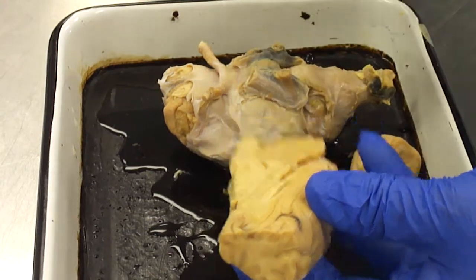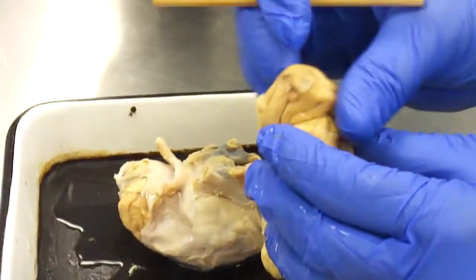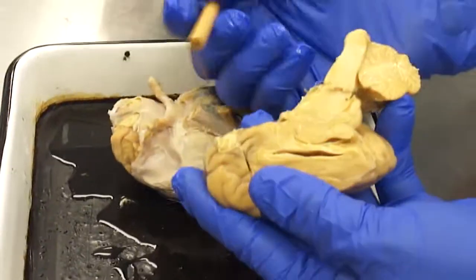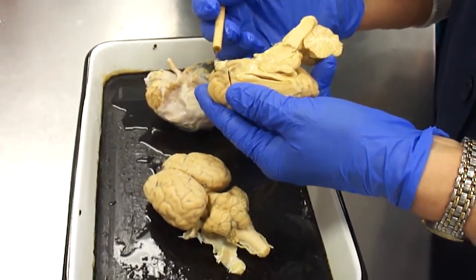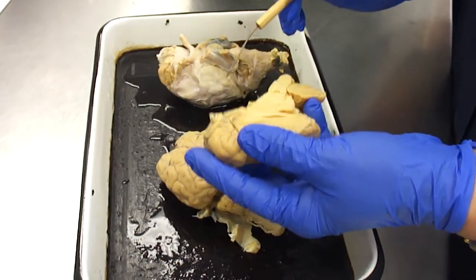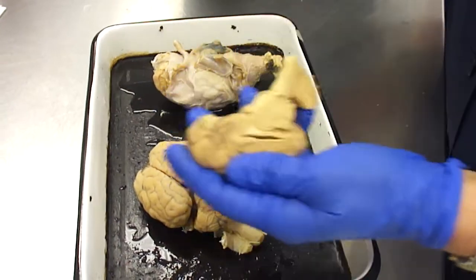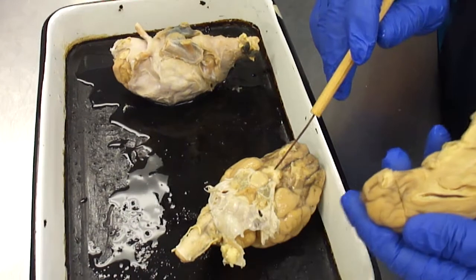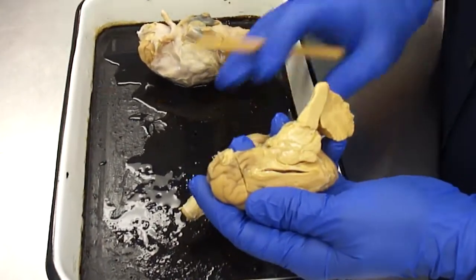Well, the olfactory bulb is cut off of this one, but you can see it rostrally. It's a little sticky-outy bulby type thing. Optic chiasma, I would ask on a complete brain so that you could see where it was crossing. That's where the optic nerves cross to form the optic tracts.